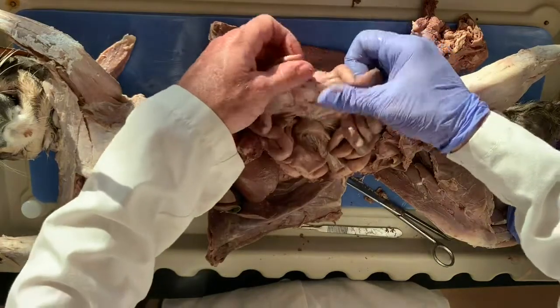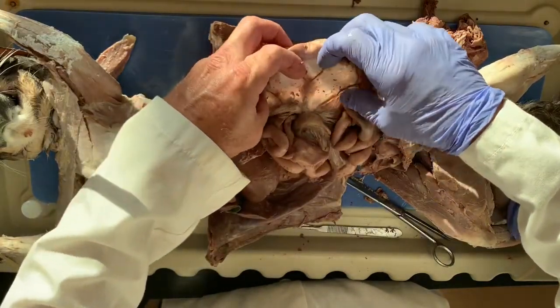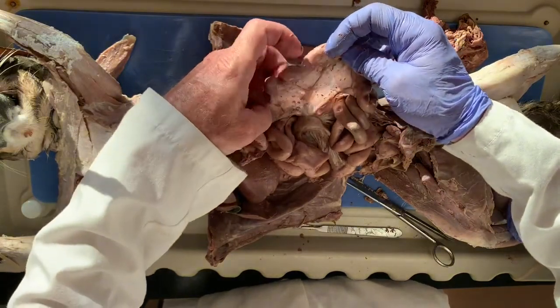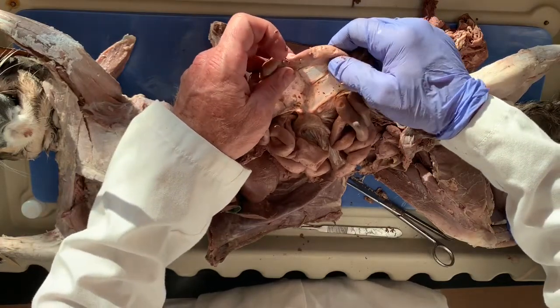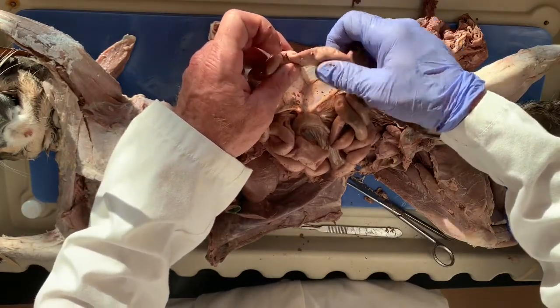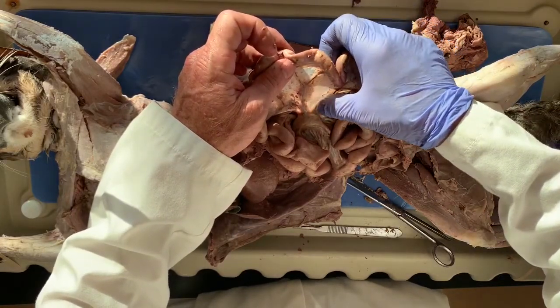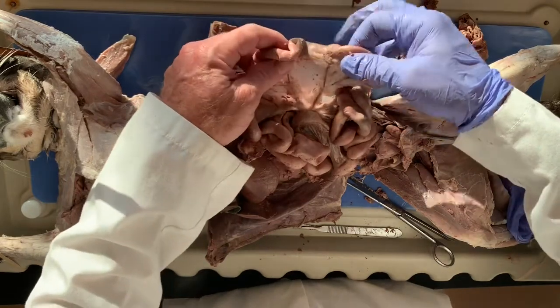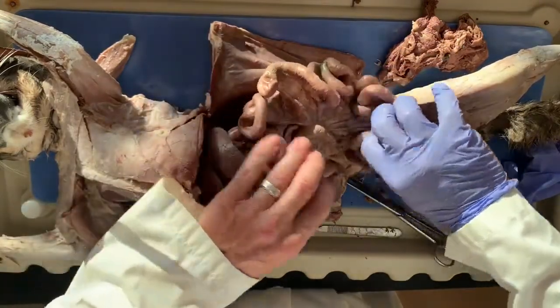And you can see if we spread it apart, you can visualize the blood vessels that carry the nutrients of digestion, the amino acids, the glucose, the fatty acids, away from the intestinal lining to the liver to be filtered, to the kidneys to be filtered out. Okay, so this is pretty cool. It's like this stained glass of your abdominal cavity.